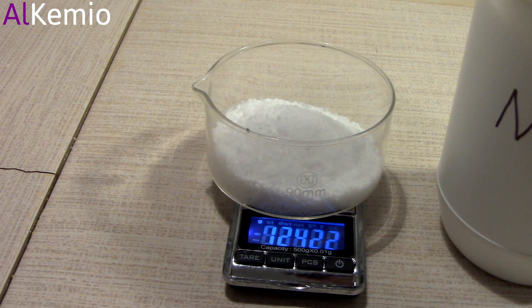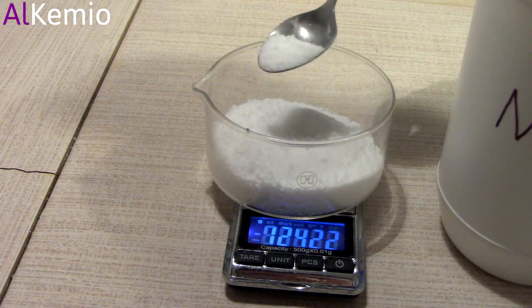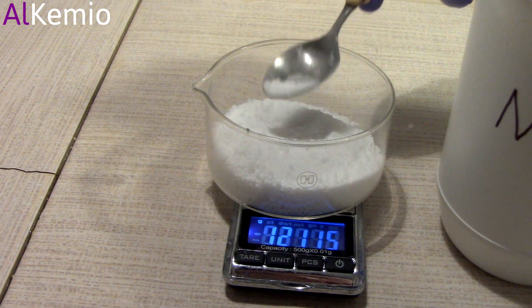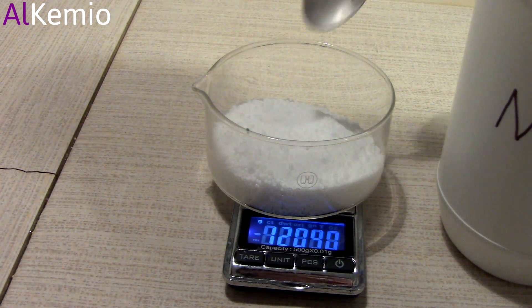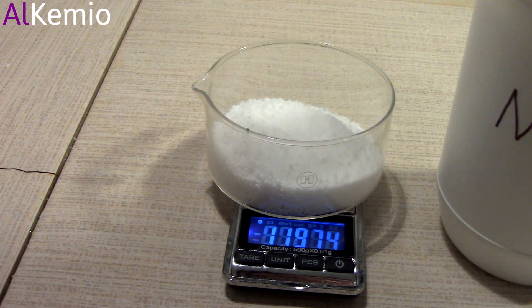Okay, that is a bit of an overkill, so I will remove a bit. But I have to be quick as well since sodium hydroxide is very good at absorbing water.